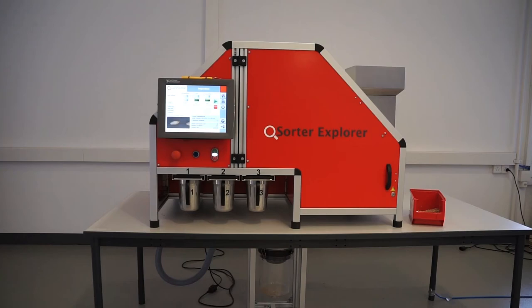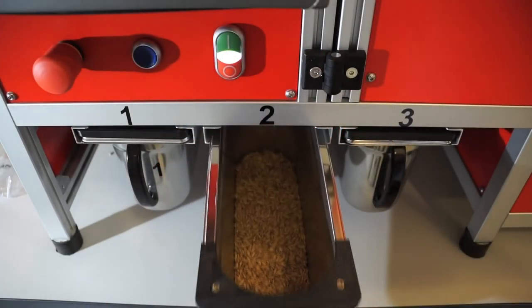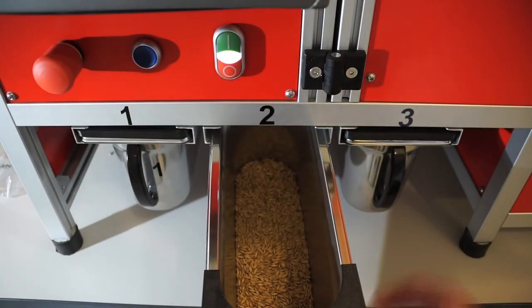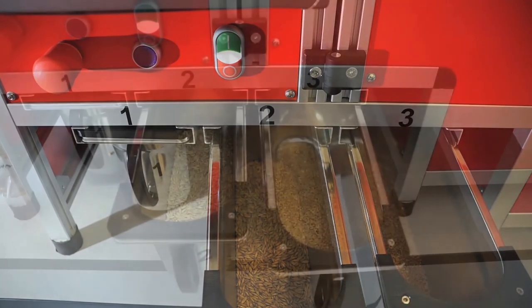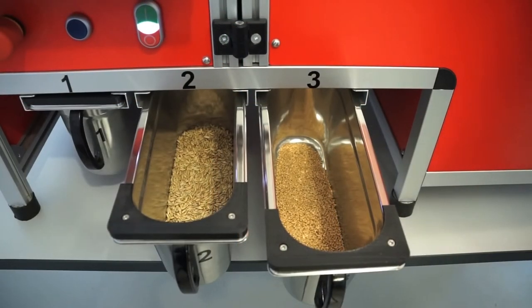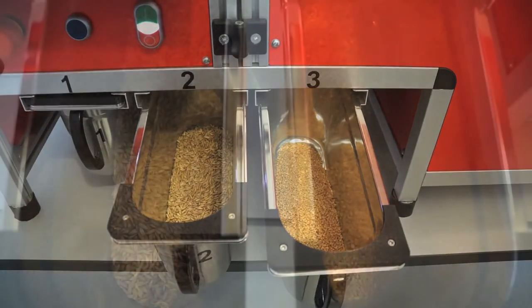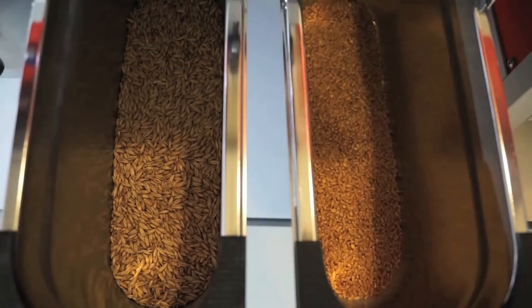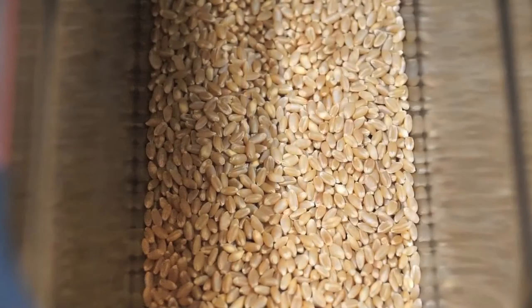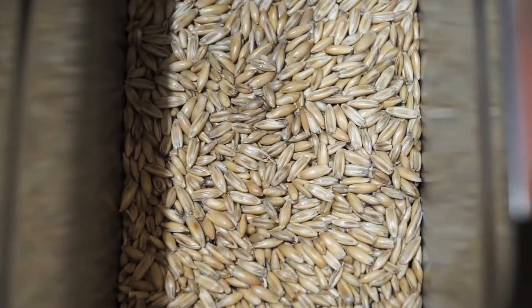In this demonstration, gluten-free grains are being tested for the presence of contaminating grains which may contain gluten. When the sorting drawers are inspected, the gluten-free grains have been properly segregated to the center drawer, while the contaminants can be found in the drawer on the right. Grain by grain, this process has provided a thorough analysis of the crops delivered to this facility.